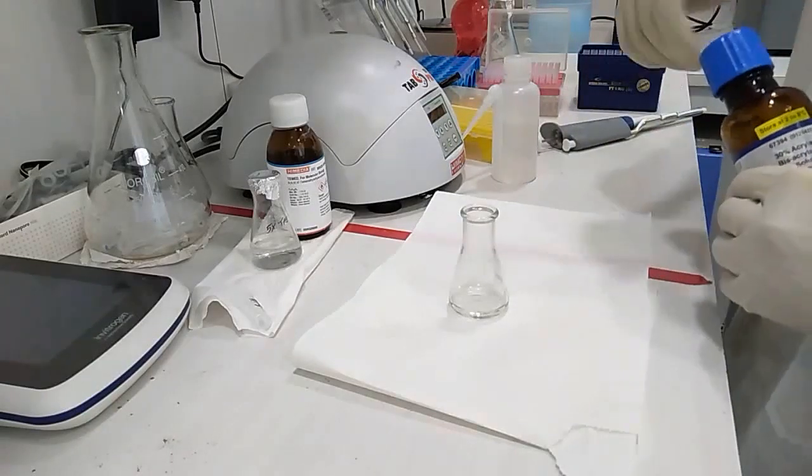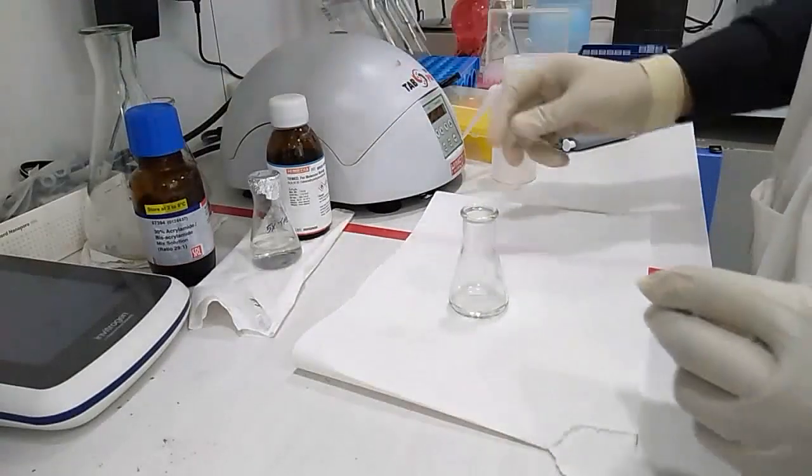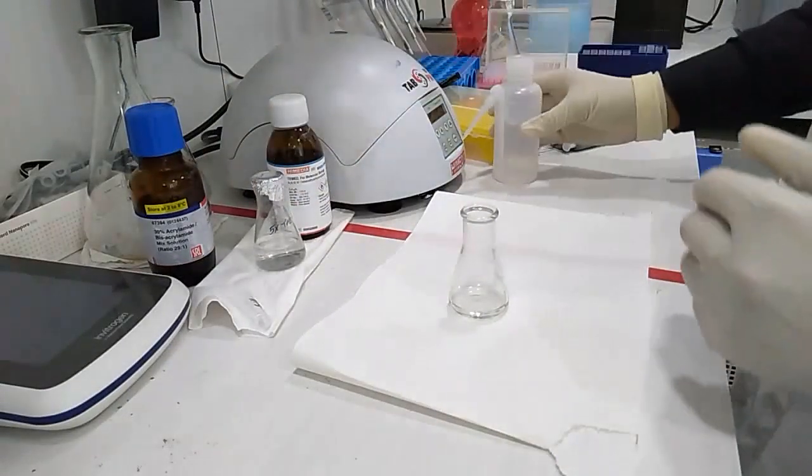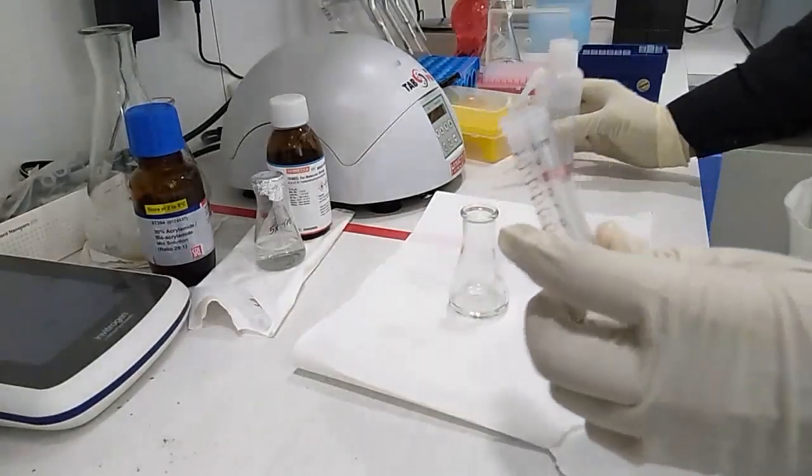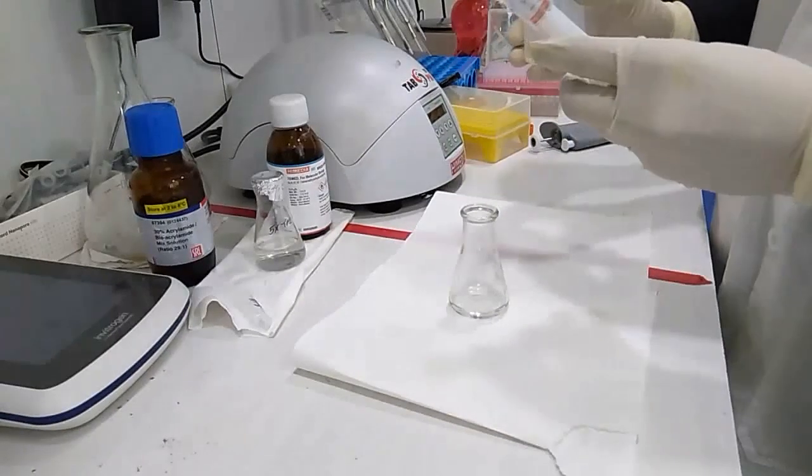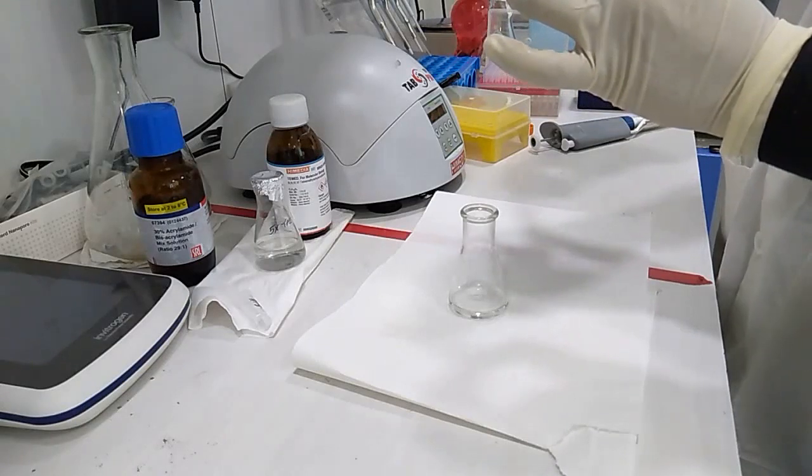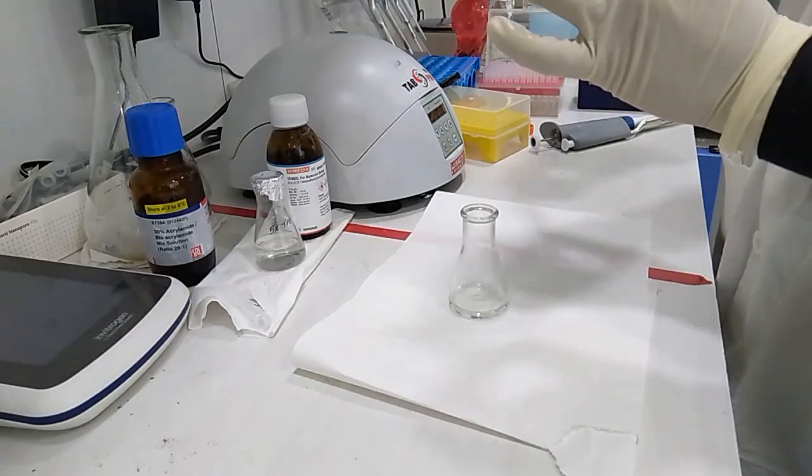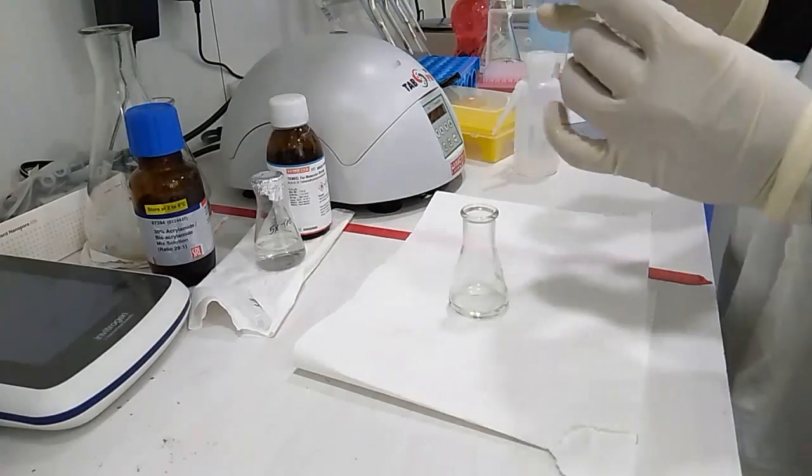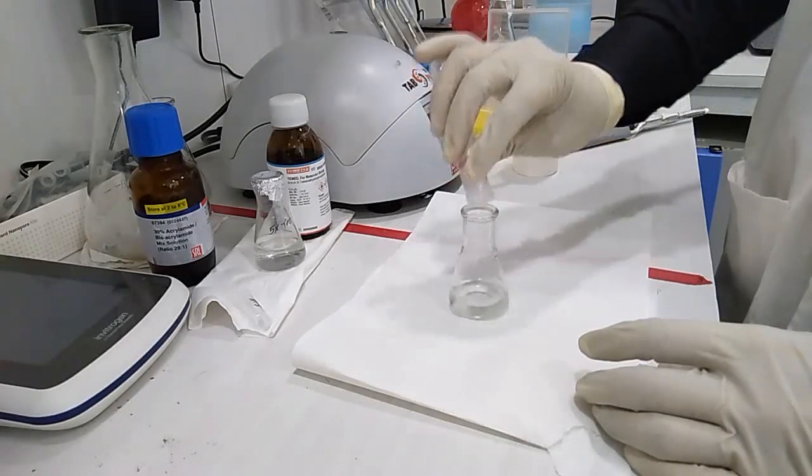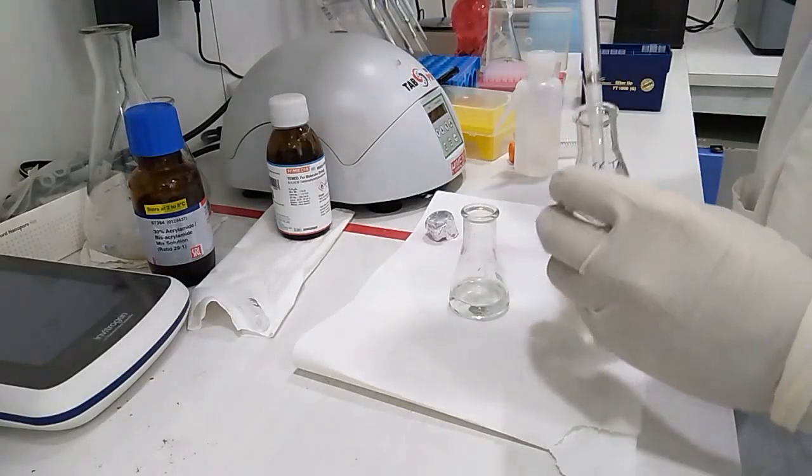As we are making 10% gel solution, we need to give water. We'll give water.